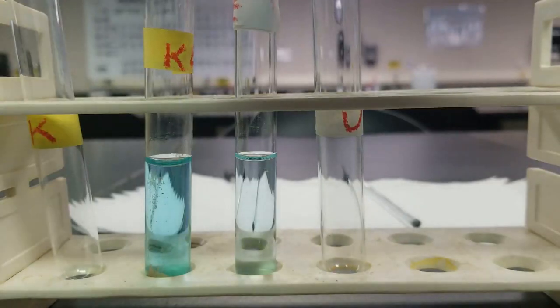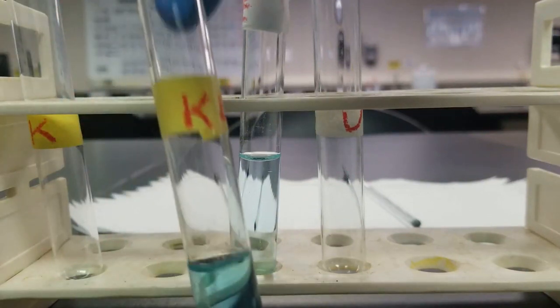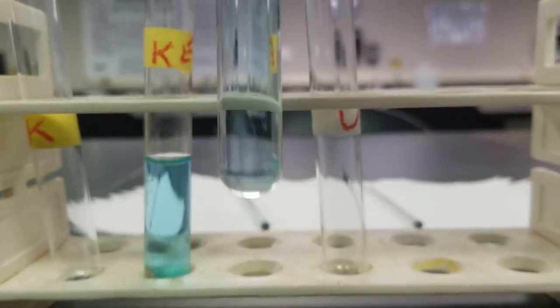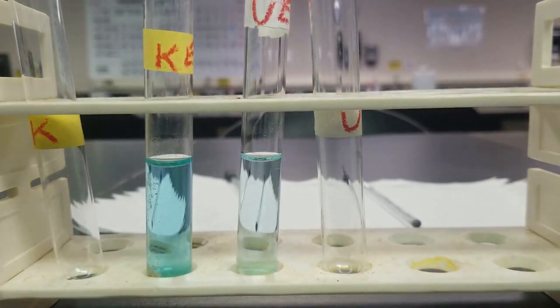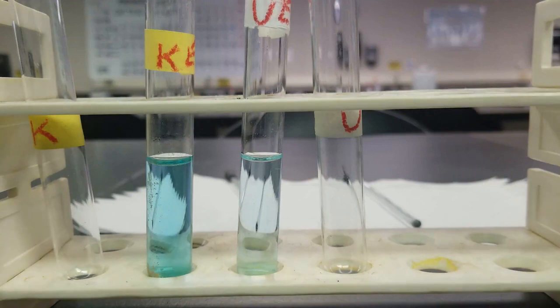All right, back at it. So you can see I've centrifuged out all that kind of gunk down on the bottom of my known. And then, of course, my unknown did not have any precipitate, so there's no precipitate there. To confirm that everything's precipitated out, I can add some more of the copper nitrate and see if more precipitation forms. So as you can see, no more precipitate is forming. So that means all the stuff that was causing the precipitation is gone.